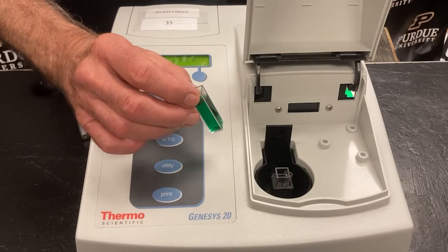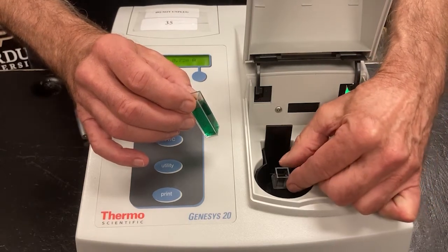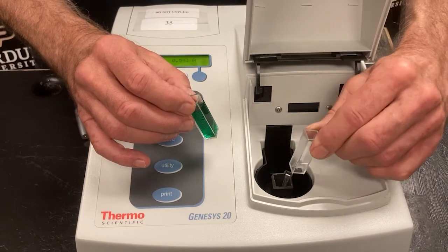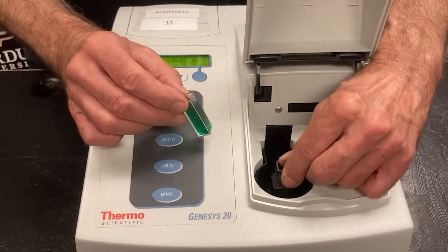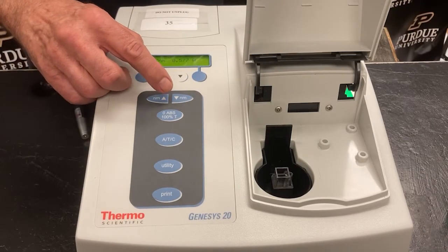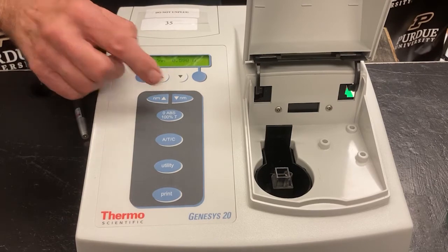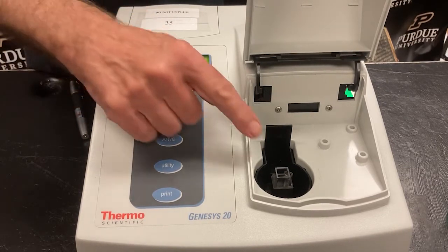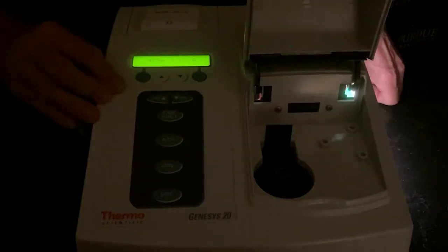So, we looked at the green solution previously. And I just want to show everyone where the solution goes in the spectrophotometer. And that would be right here. The cuvette goes into this little compartment. And so, if I were going to put the green solution in, that's where I would put it. And then we have the ability to select wavelengths up and down through the visible spectrum from about 400 through maybe 390 nanometers up past 700 nanometers. And we're going to show you what that looks like with the light coming through the cuvette. Bill, shall we darken the lights?